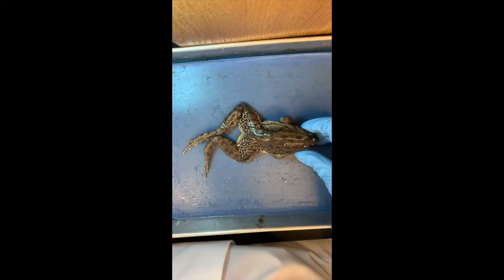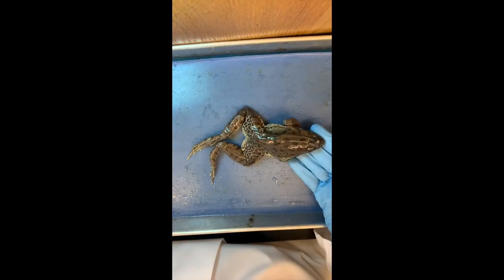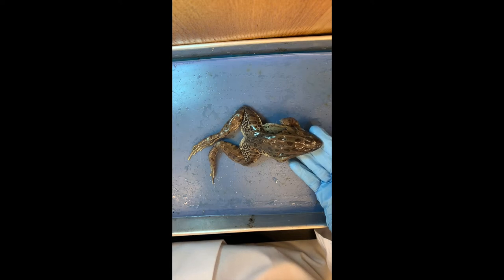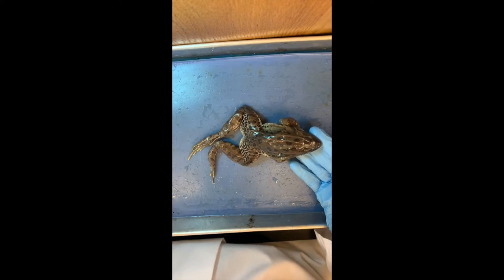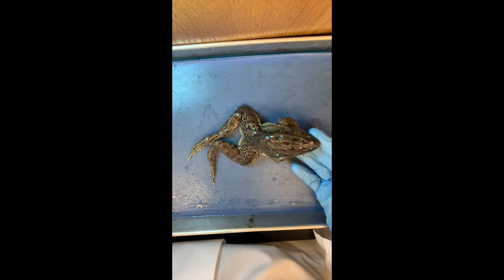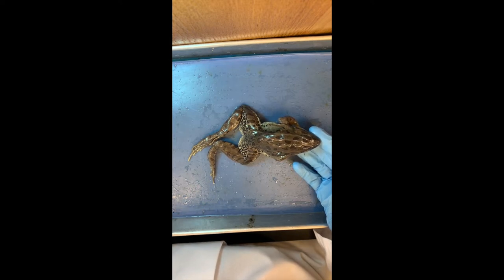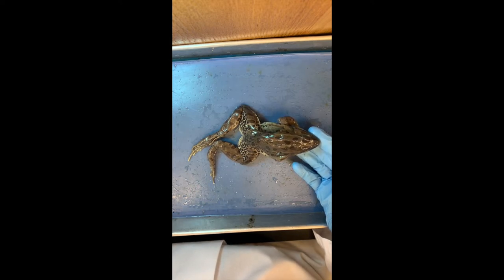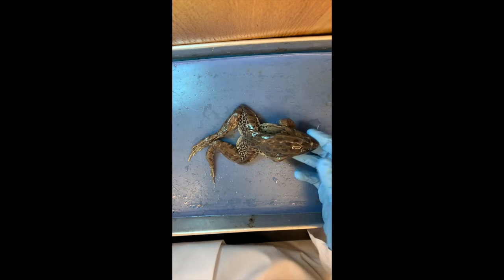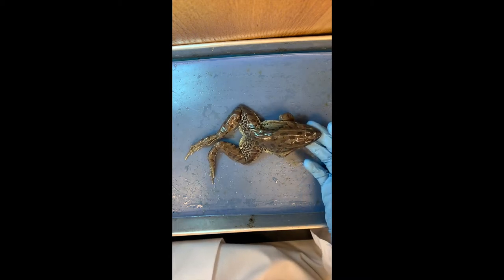So let's look at this frog — bilateral symmetry. Protostome or deuterostome? Deuterostome, like all chordates. Coelomate — yes, they do have a coelomic body cavity with complex organs in it. We'll see that in a minute.